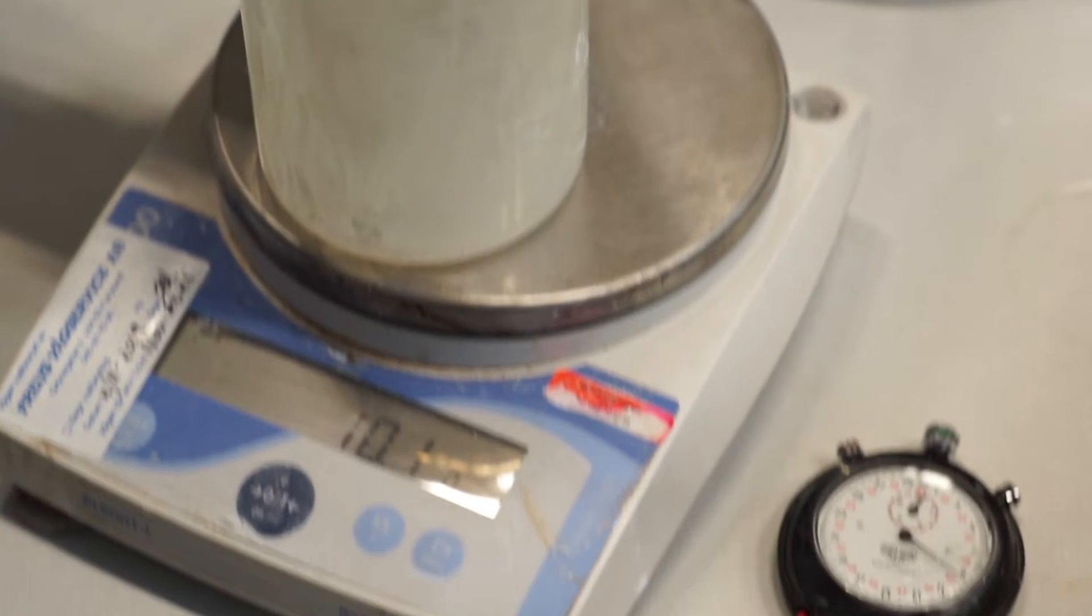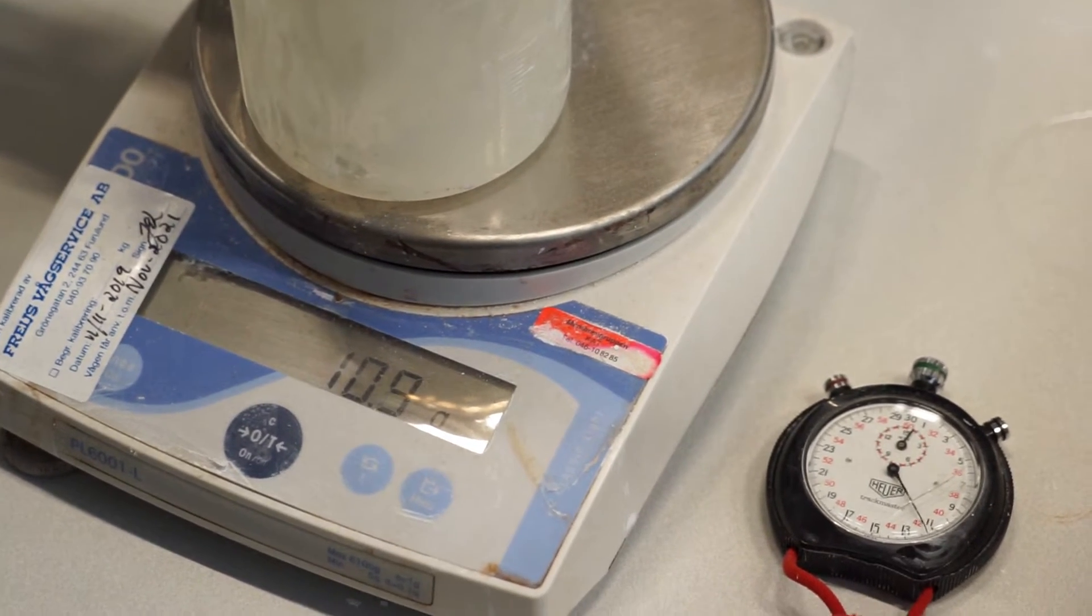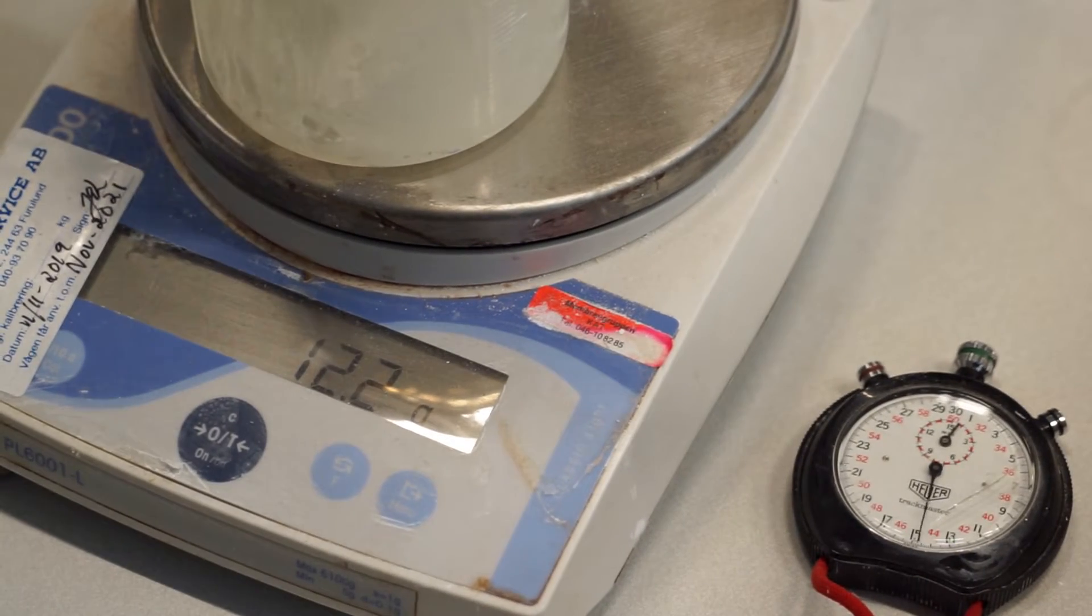So now it's just a matter of waiting. Yeah, so we just let this run for a while.